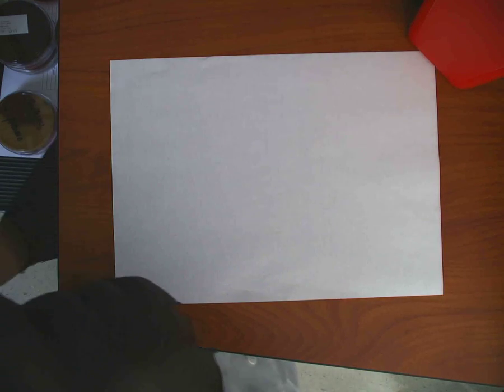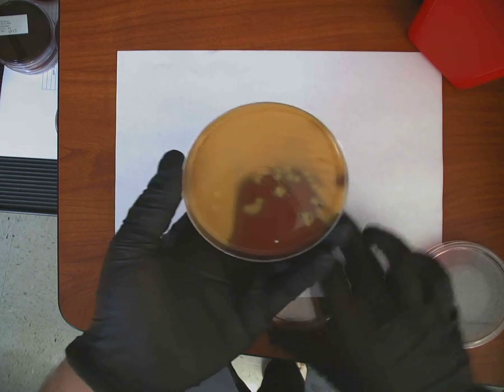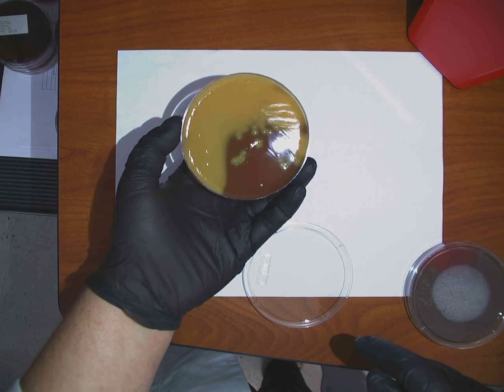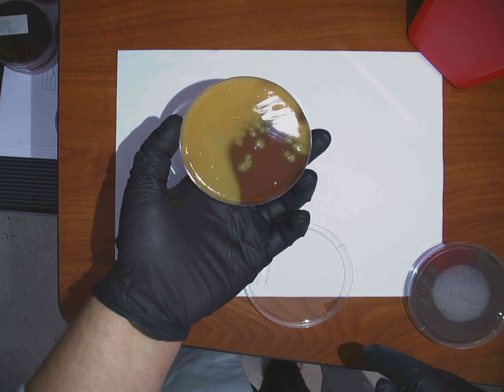All right. So let's look at this. We're going to see what it's not, and I'll cut the lamp on if I need to. This is a sputum sample. So I'll read my chocolate plate first. Wow. Okay. You see the sheen in it? Now, agar's going to have a sheen anyway. But you really can't see the colonies. All you can see is that color change, correct?